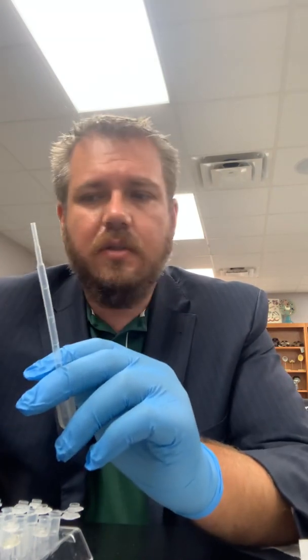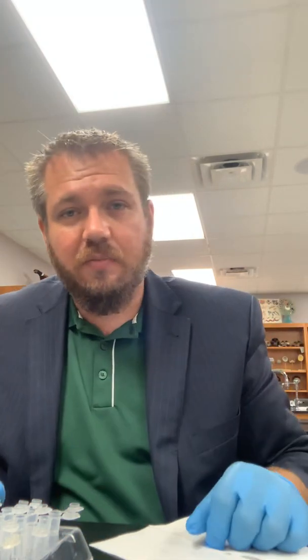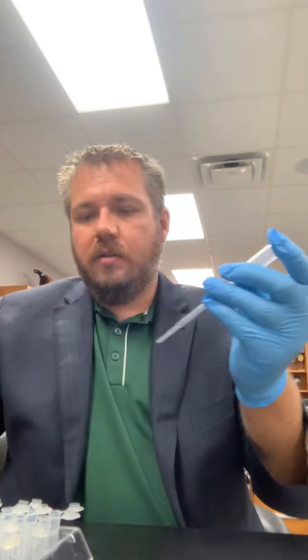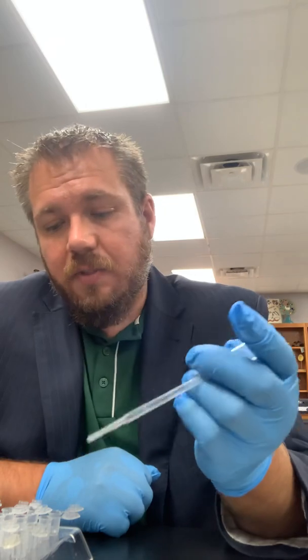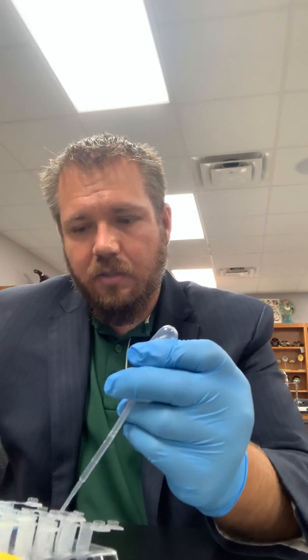Other things I've seen students do is they'll label some paper towels and set them in the right place on the paper towel. You can do that, but if you accidentally hit the paper towels, you've mixed up your transfer pipettes. I recommend just writing on the side of the transfer pipette, just like we have with the stock tubes. Again, like I said, what you need to do now is transfer half a mil into this tube, and then another half a mil into the next tube down, and half a mil into that final tube.